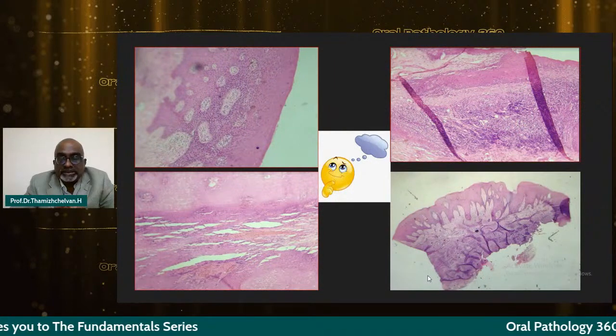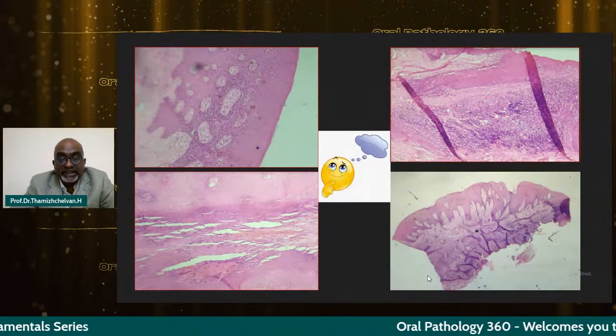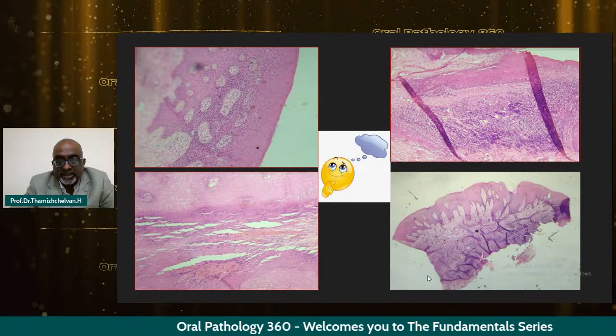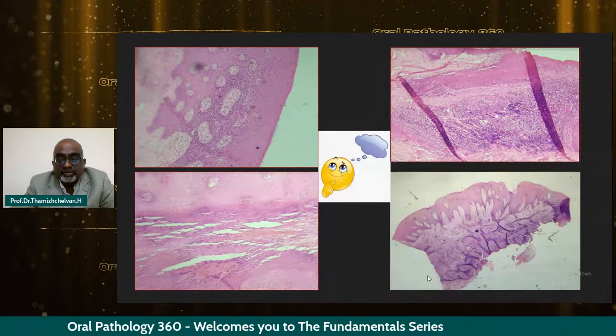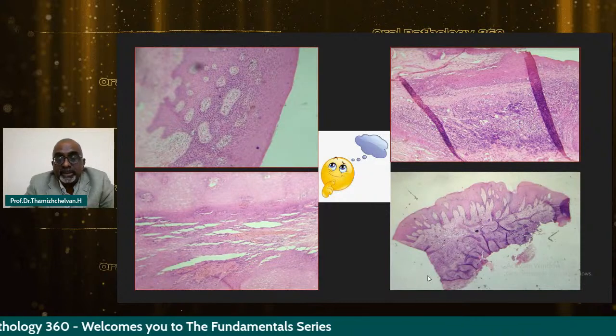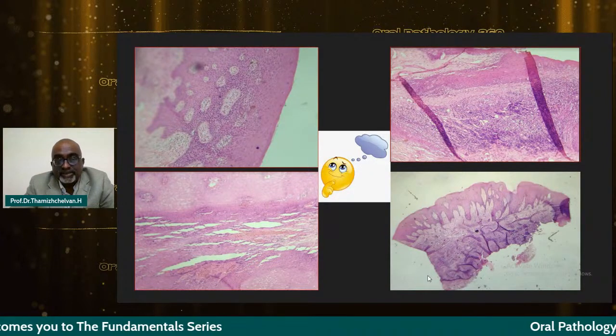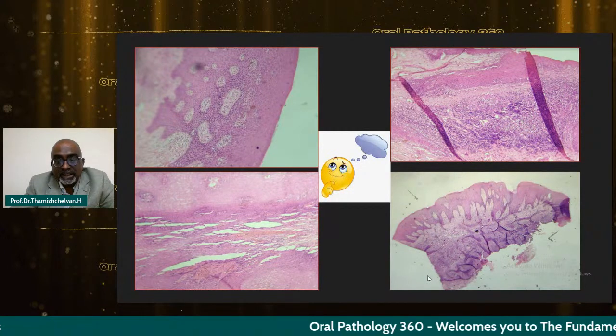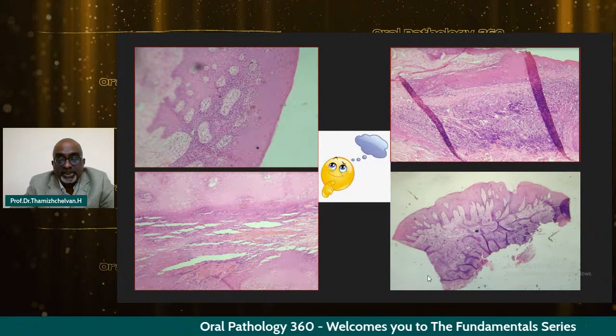These are pictures we normally see in our day-to-day practice, but we don't really bother about them. But ladies and gentlemen, there are high chances that such slides can interrupt your publication process, especially when you're going for peer-reviewed journals and international articles. These photographs will not be highly appreciated.